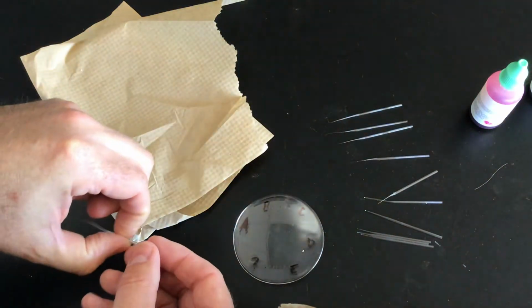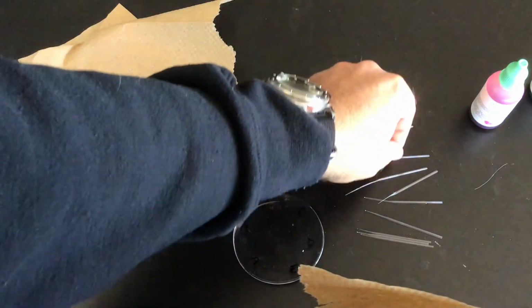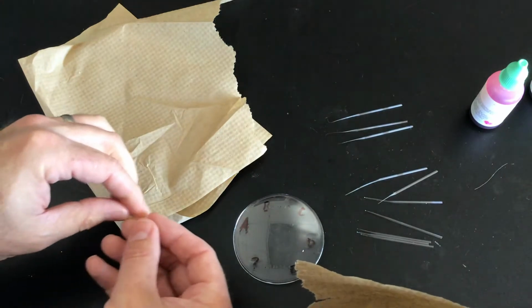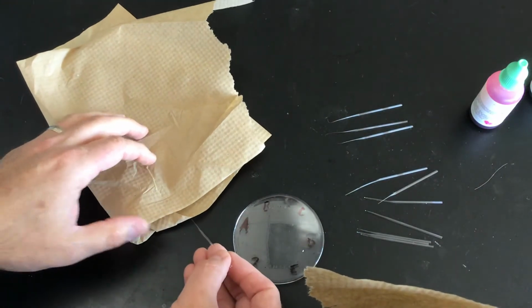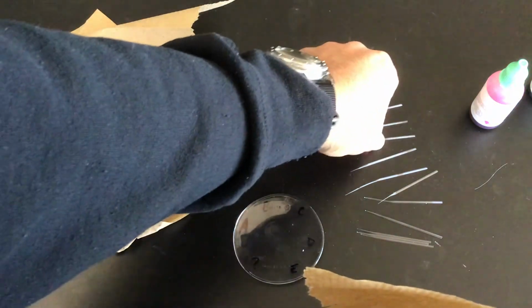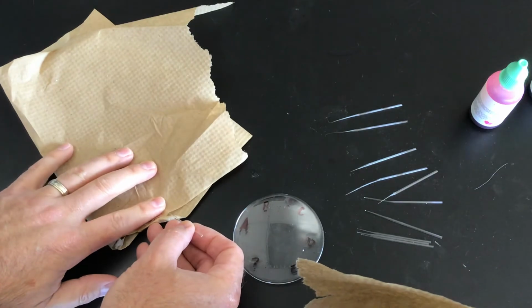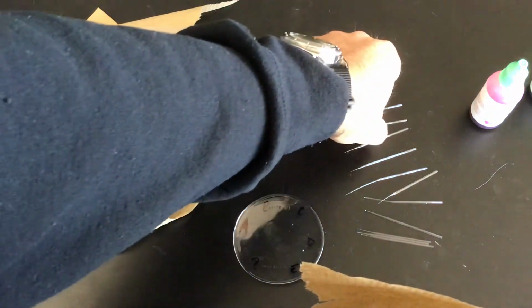And if it turns out when you go to use it that it didn't break off enough of the tip, then you just go back and you can try it again. I've made a few extras of these because sometimes the tips break off too big and you get too big of a spot, and that would mess up our experiment down the road, okay?